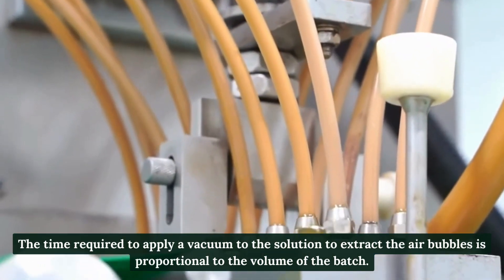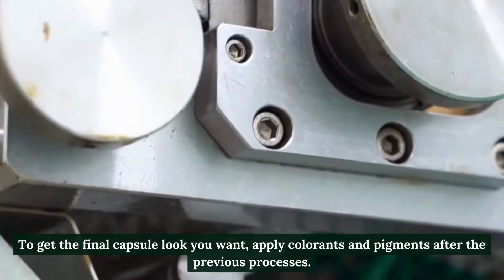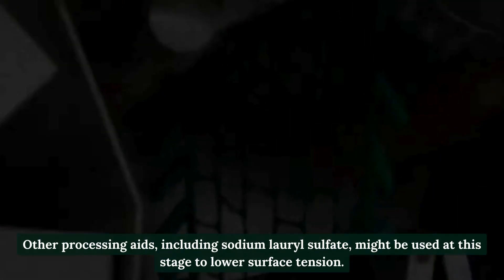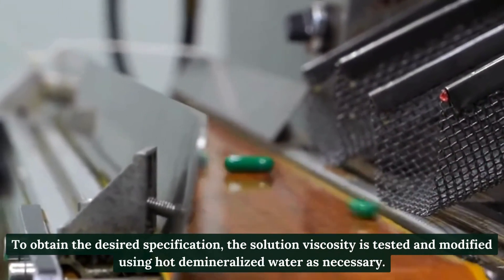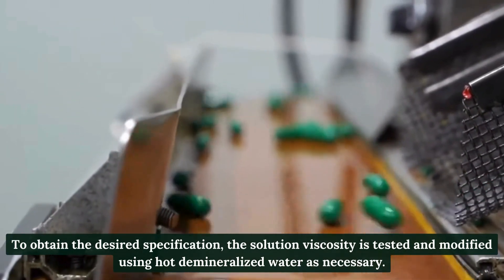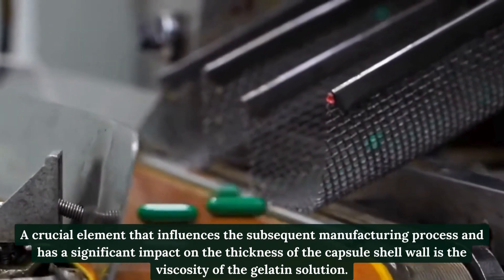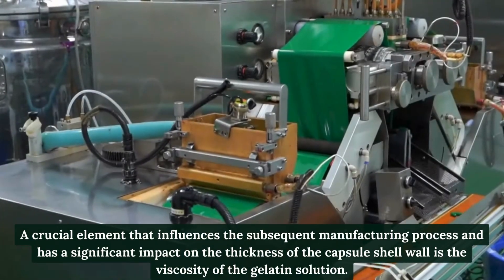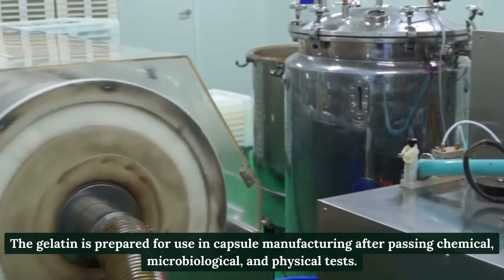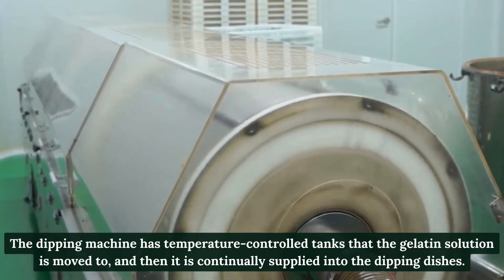Colorants and pigments are applied after previous processes, and other processing aids including sodium lauryl sulfate may be used to lower surface tension. Solution viscosity is tested and modified using hot demineralized water as necessary. Viscosity is a crucial element that influences the subsequent manufacturing process and has a significant impact on the thickness of the capsule shell wall. The gelatin is prepared for use after passing chemical, microbiological, and physical tests, then transferred to temperature-controlled tanks in the dipping machine.